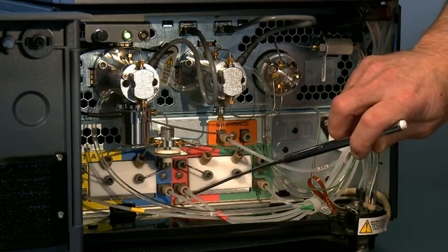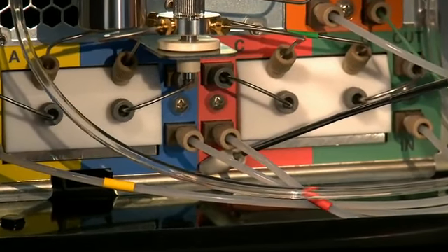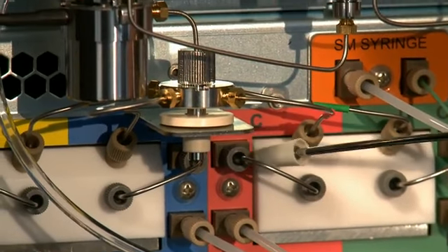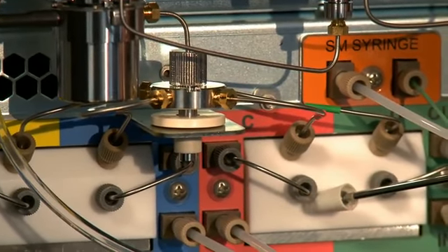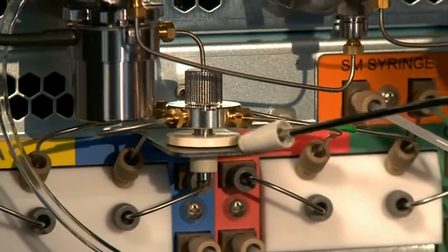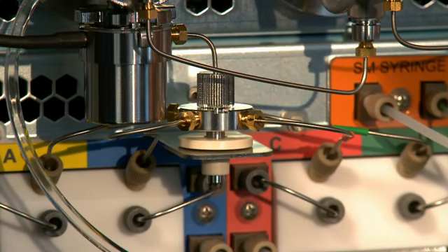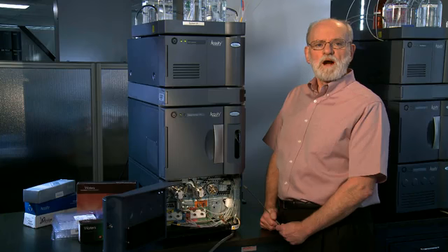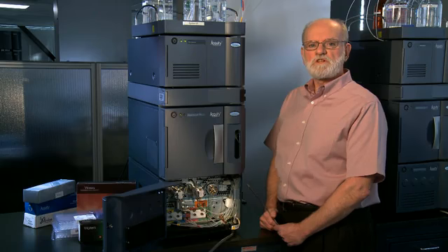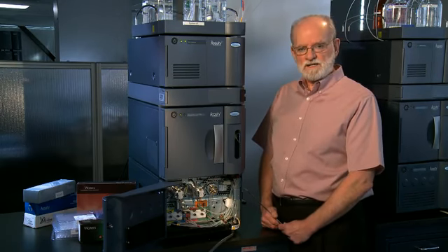It comes first into a vacuum degasser that eliminates any dissolved gases that could interfere with the flow or compromise the proportioning. The flow comes out of the vacuum degasser into the gradient proportioning valve and out of the gradient proportioning valve to a manifold where the 4 solvents meet for the first time. The gradient proportioning valves open in sequence where the proportion of time that each valve is open corresponds to the percentage of that solvent that is specified in the gradient table.